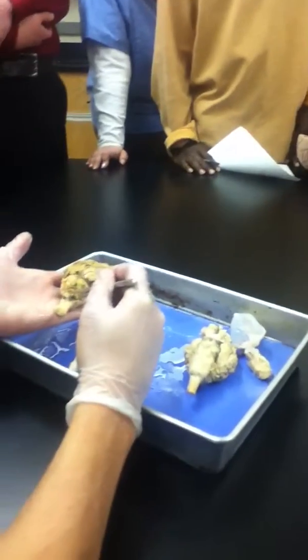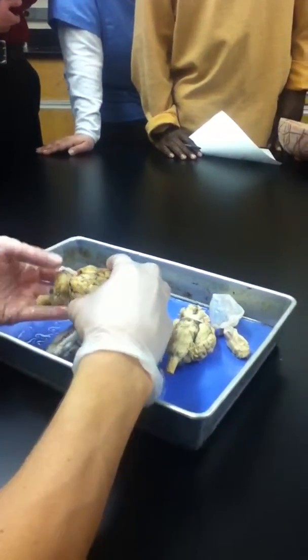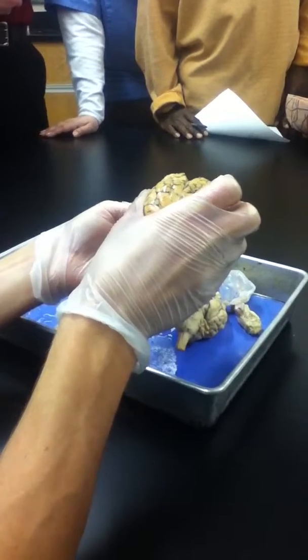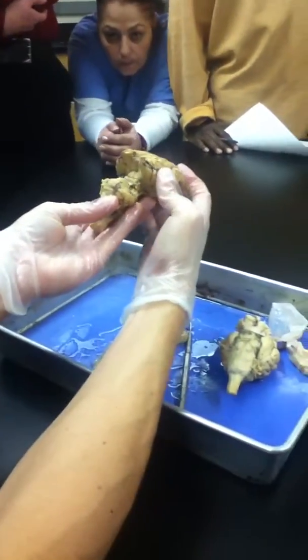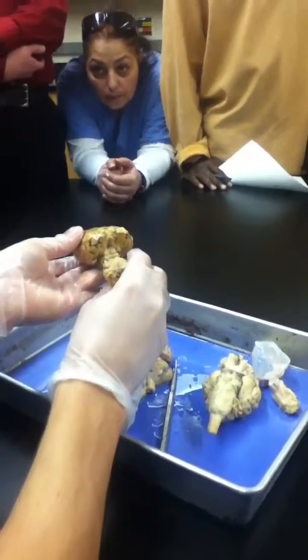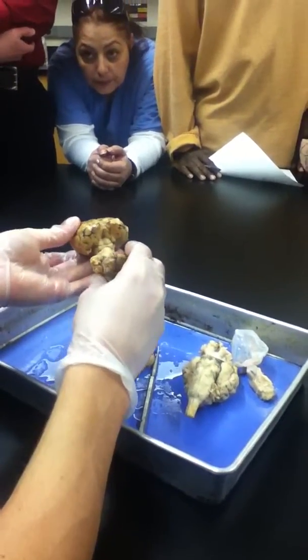What major brain region is this? Cerebellum, good. Now, if I open the transverse fissure that we named before, and we look down in there, there are two pairs of bumps. A bigger pair sitting on top of a smaller pair. Those are the four twins. The top pair of bumps are the superior colliculi, and the bottom pair the inferior colliculi.